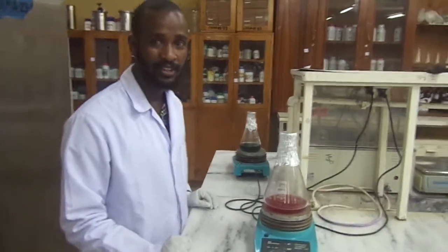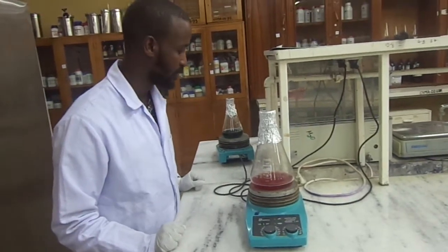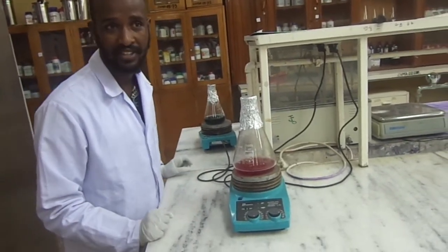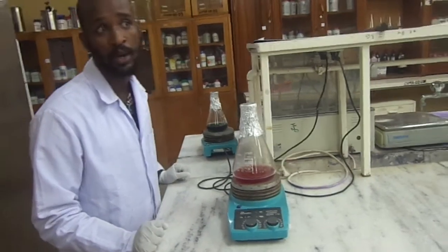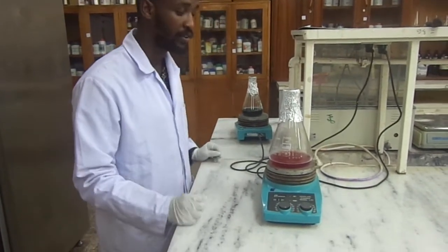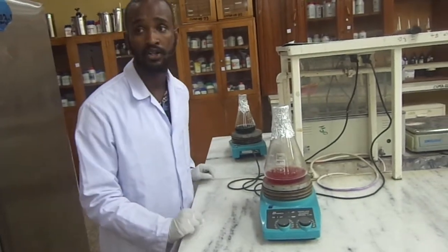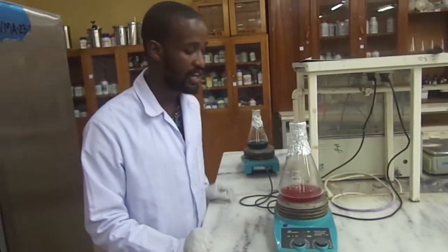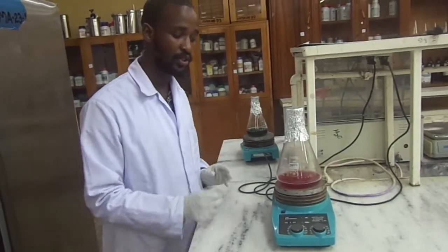Hello, welcome to our laboratory microbiology session on biochemical tests. Our focus today is on IMVIC tests, and specifically we are starting with the citrate utilization test and the Triple Sugar Iron (TSI) agar test.